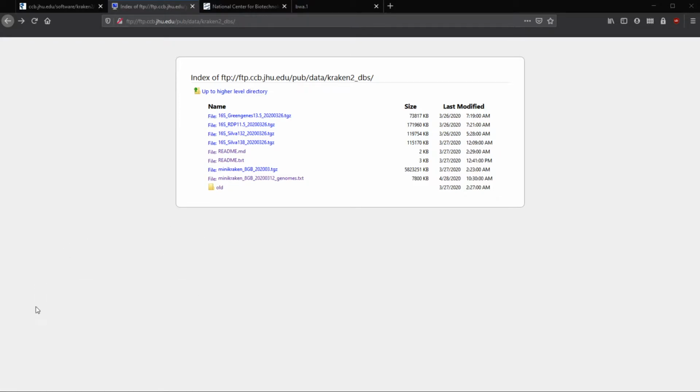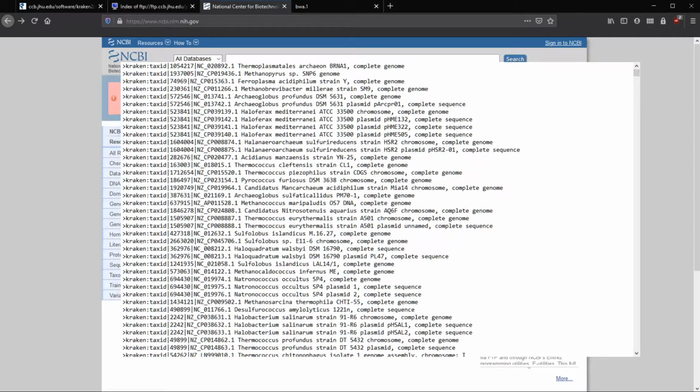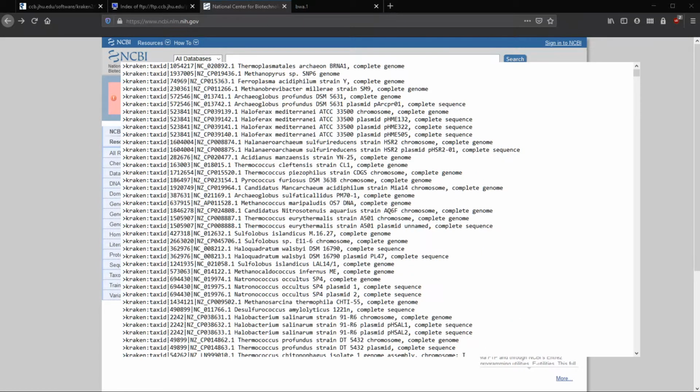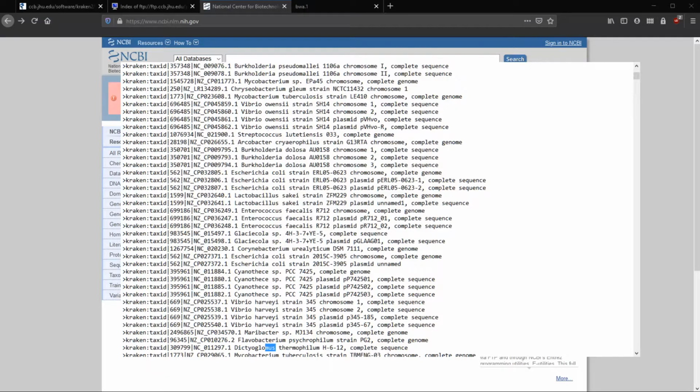Let's go to the text file and see whether or not our items are in. So here's the text file. Let's actually go to NCBI here quick. So let's look for the taxonomy for mouse and human. We want our tax ID, because in the text file, we can see here that we have tax IDs for these. And it's a lot easier than searching for names, so tax ID is going to be unique for whatever we want. Whereas if we search for mus or mouse, we can try that here quick. MUS. So we'll get a lot of things that we potentially have to look through, right?